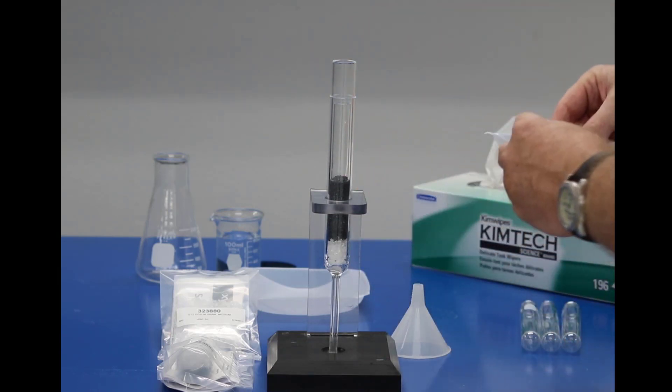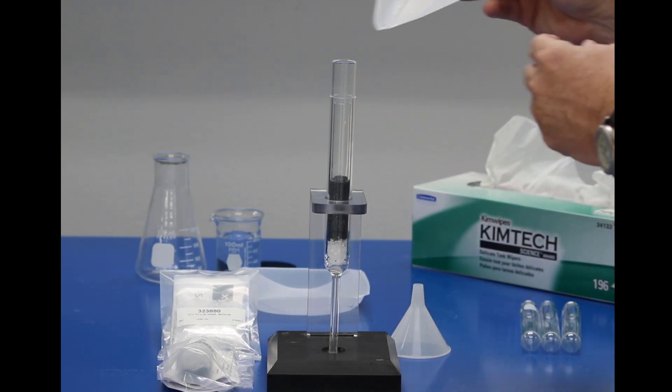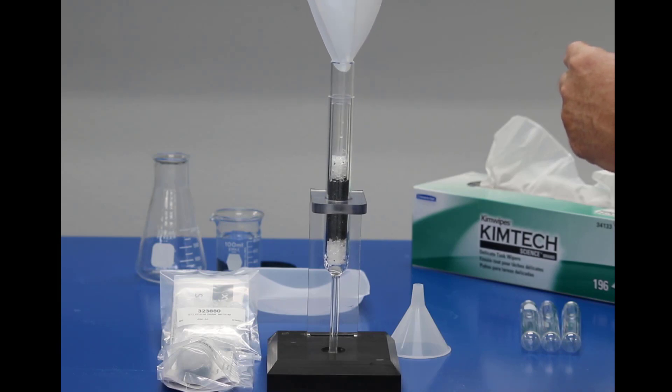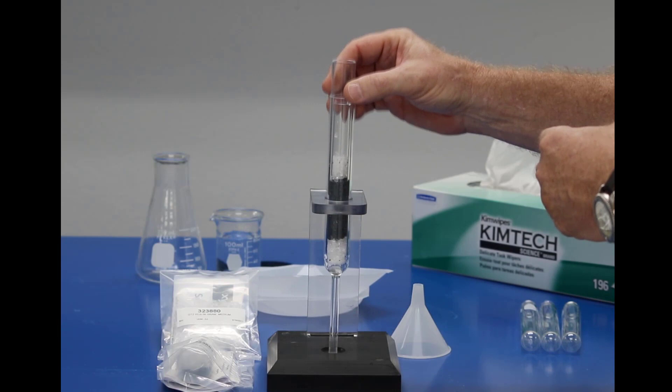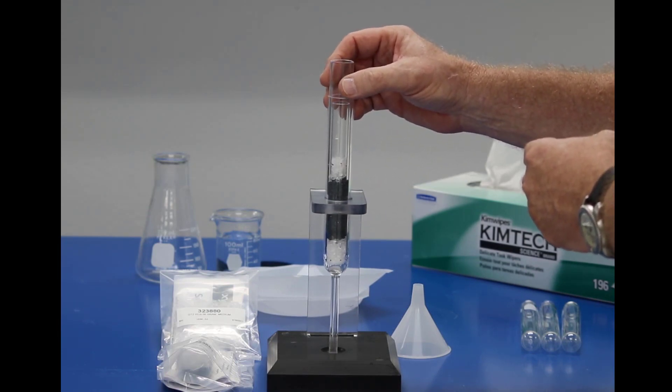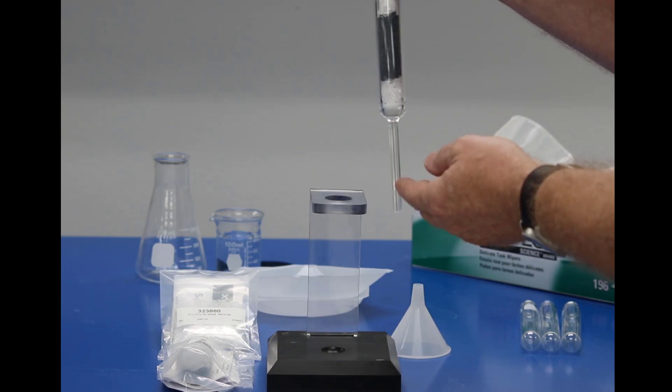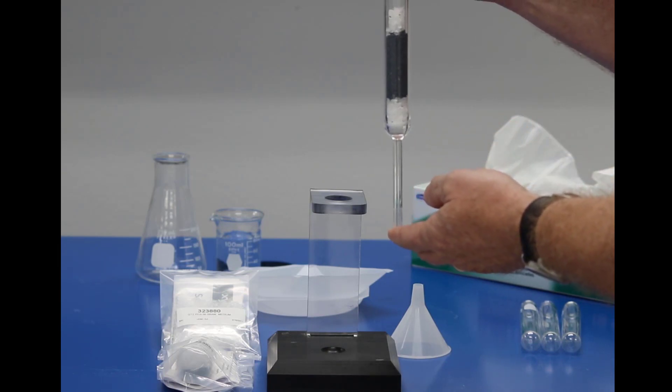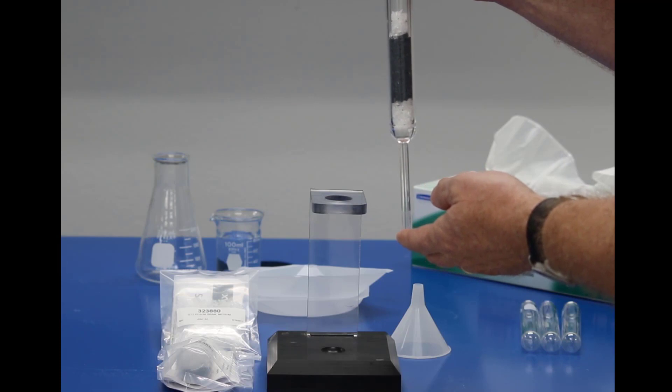And as the final step for the packing part, I will pour the rest of the quartz chips down through the center of the combustion tube. That is a complete combustion tube packed, according to our instructions.